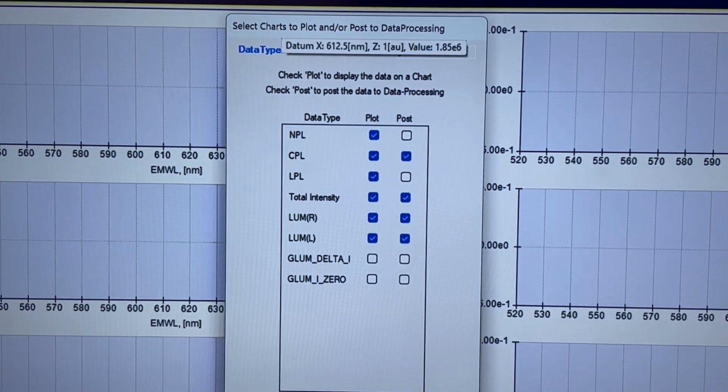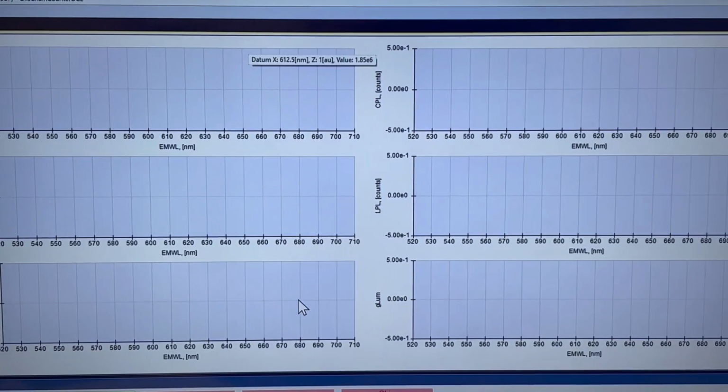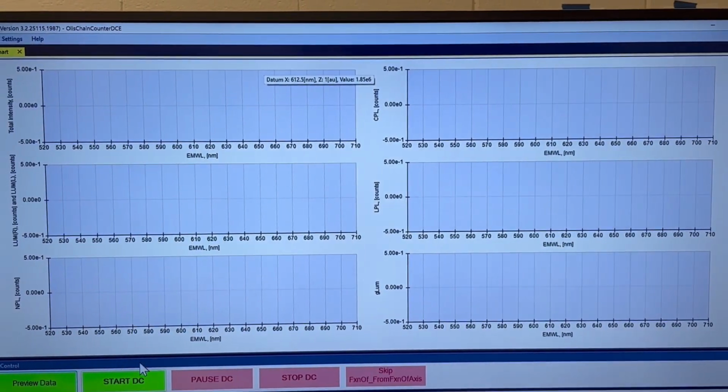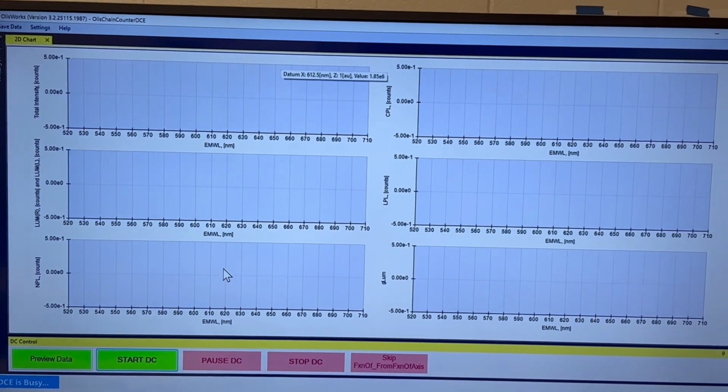Now, if I save that, the screen image will be the same, because I haven't changed the data collection. Right. Only what's going to be posted. Right. And a very nice point.